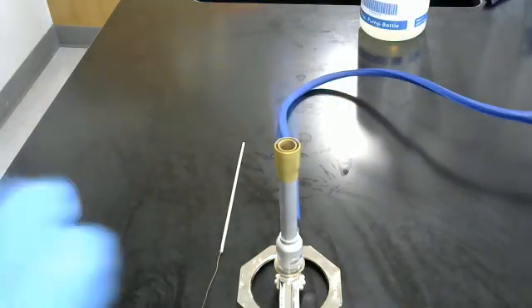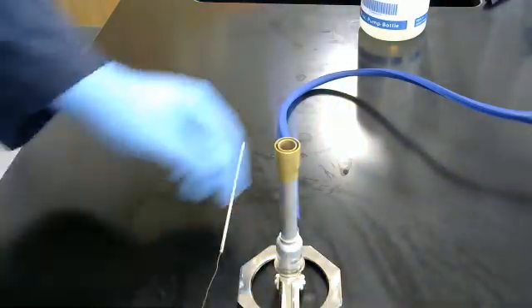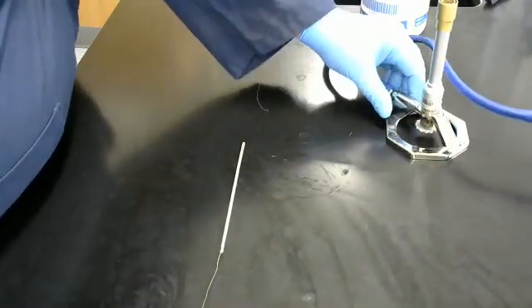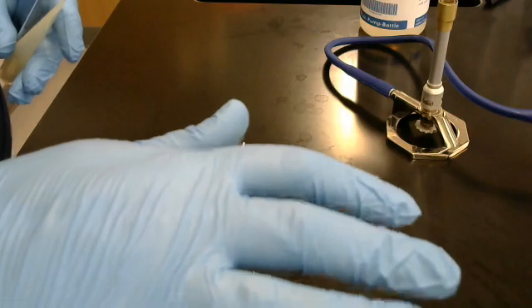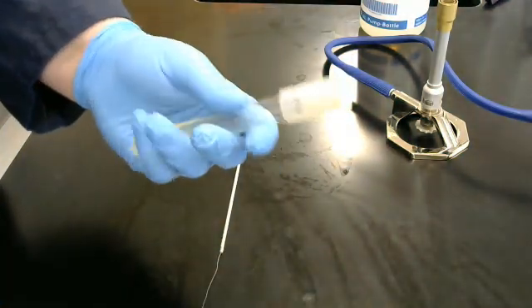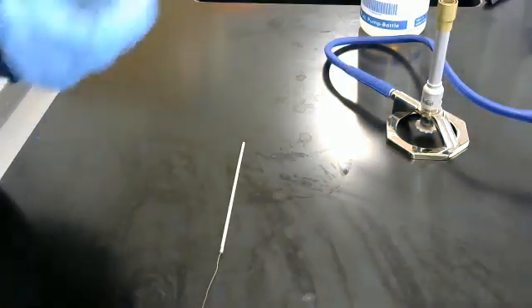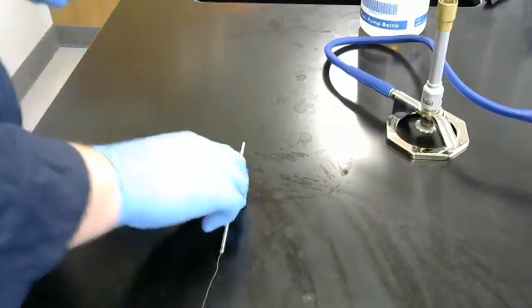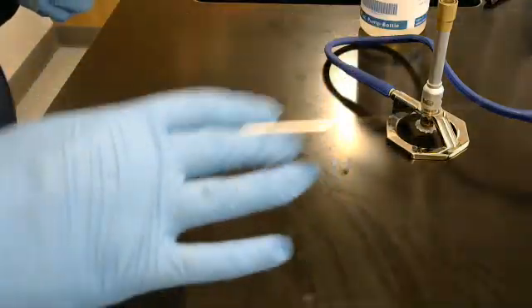Take one slant. Using your left hand. I am going to shift this back a little, so you can see this. Using your left hand, or in this case, my right hand. Well, whatever your dominant hand is, is where you are going to hold and do all the work. Remember? Normally, that is what I do. But again, I am doing the southpaw.